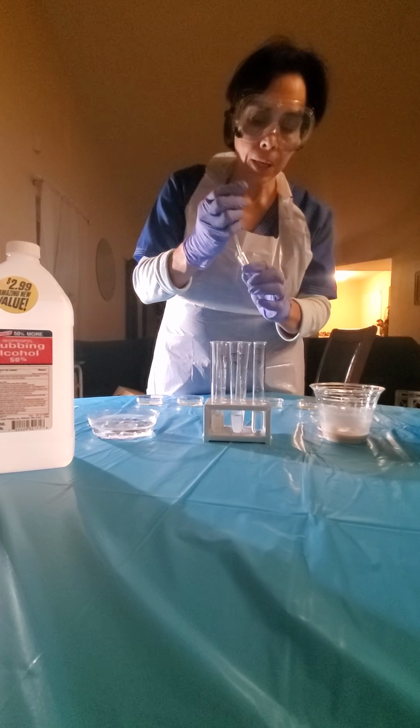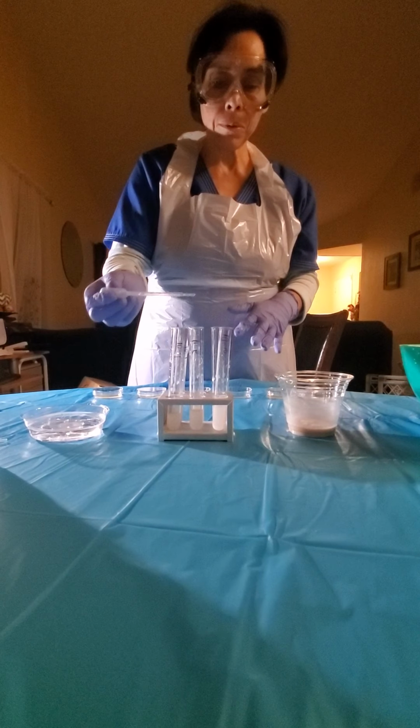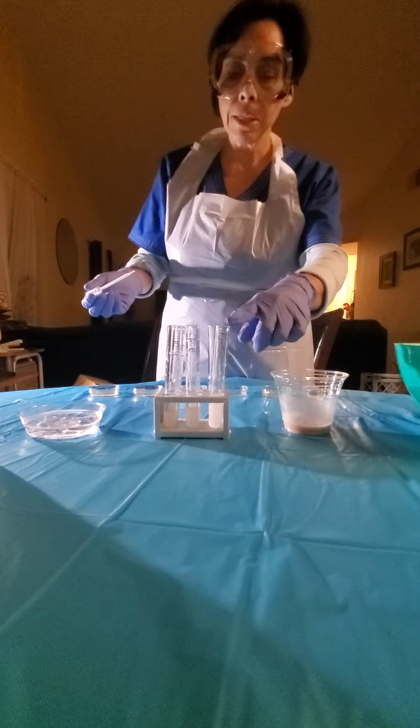We're gonna go ahead, and the continuation keeps going until we can get a clear enumeration of bacteria. So we're gonna continue all the way to the 6 tubes. So go ahead and pause, cameraman, so I can do the shorter version. So we have done all the transfers, diluting from one tube to another to another to make it thinner and thinner, ending in the 6.